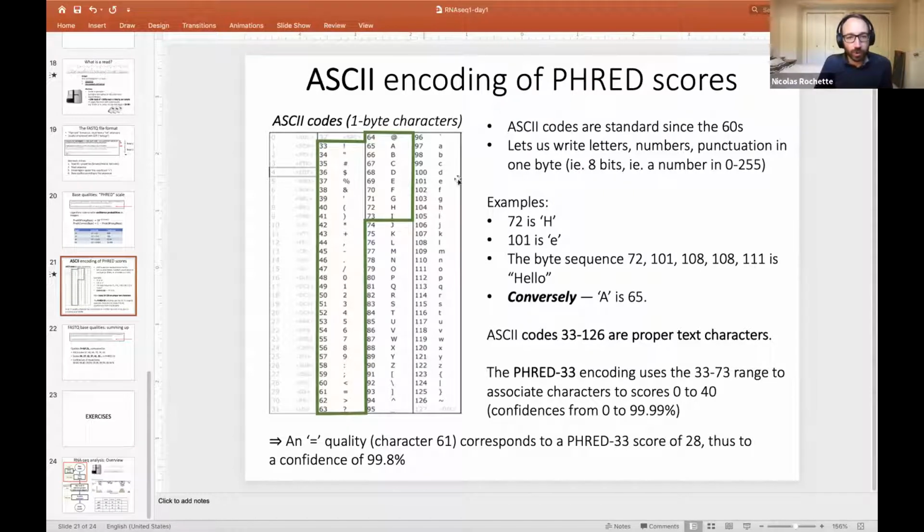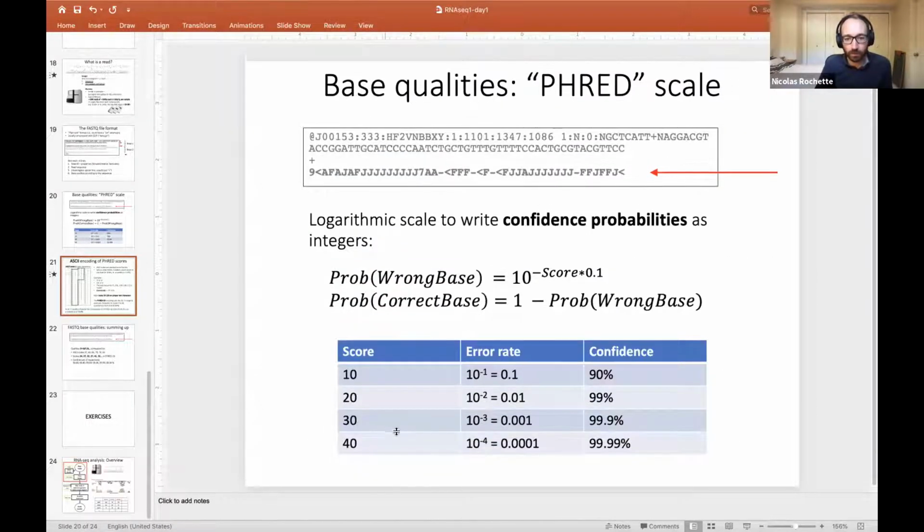So we can go back to the PowerPoint, and then G is here, so it's 71. And then we can do 71 minus 33, which is 38. And then 38 is going to be something close to 99.99%. At least something much higher than 99.9%. We'd have to open a calculator of some sort to get the actual confidence score. But it is a Phred score of 38.